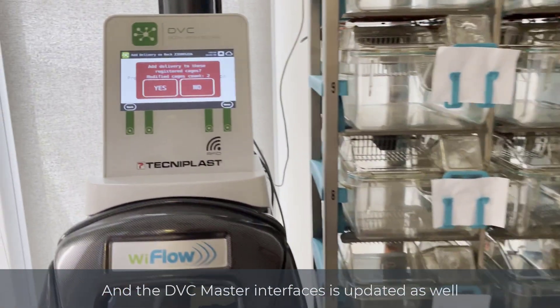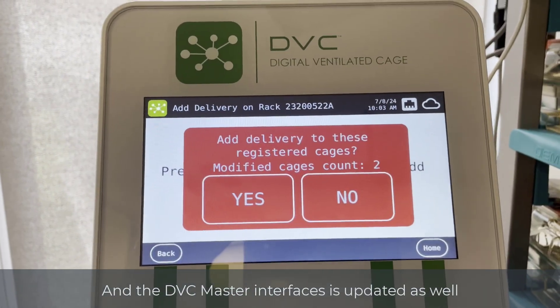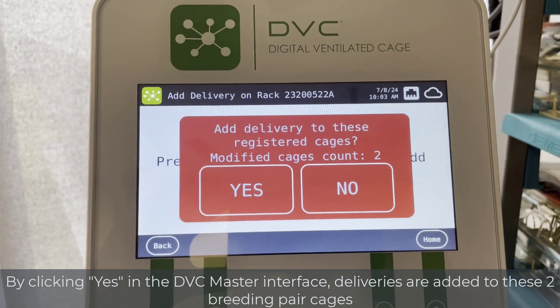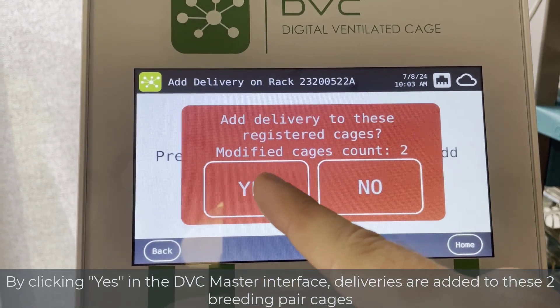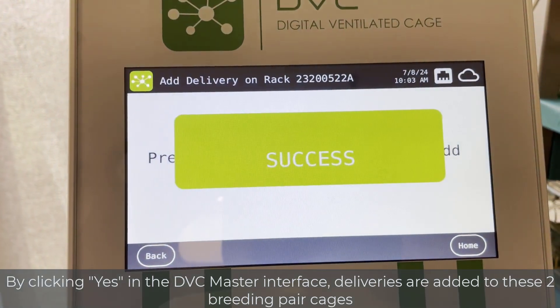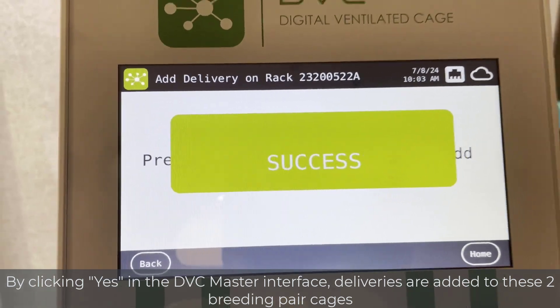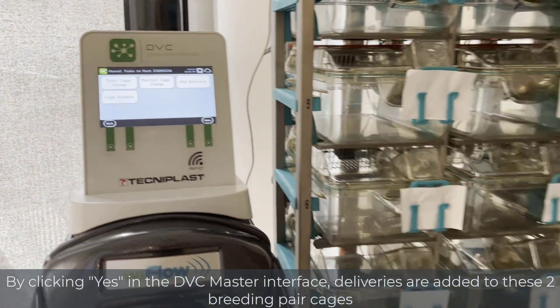This will add a delivery to the second cage. If you are done and don't have any other pups in the other cages, you simply click confirm, and this automatically creates the corresponding delivery for these two breeding pair cages.